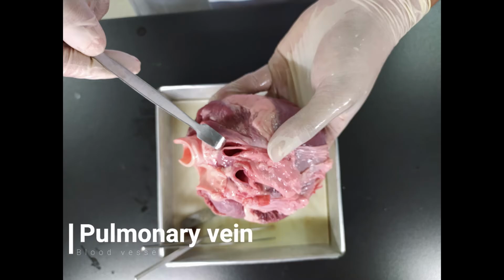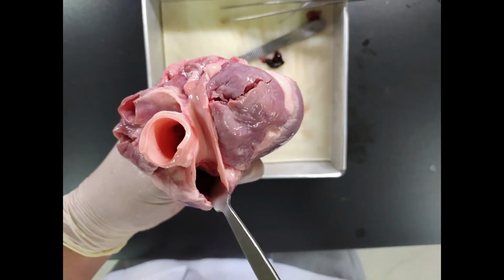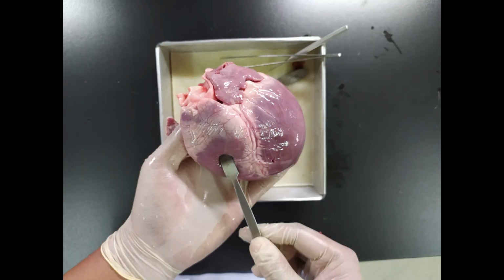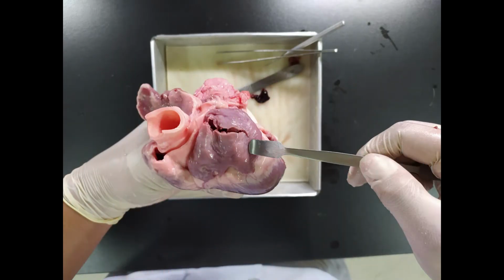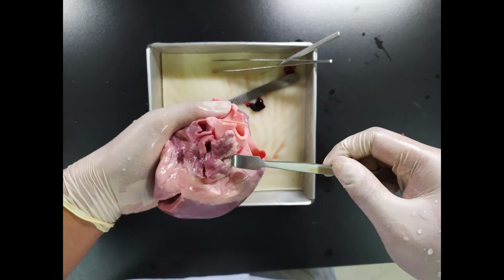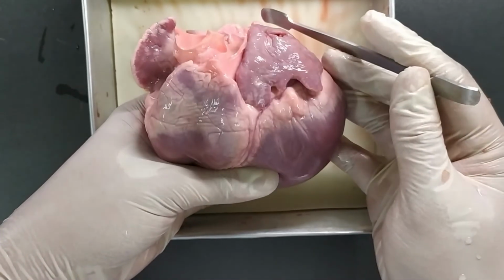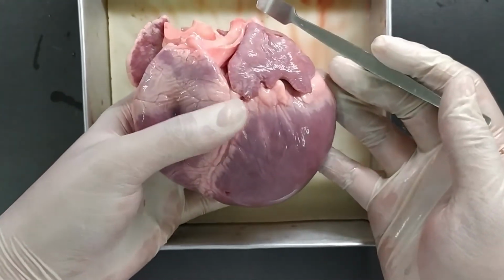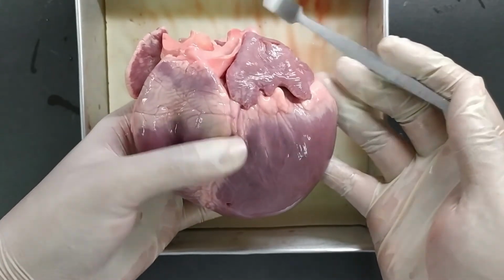Good day, students. Today, we will be dissecting a pig's heart. We will be using a pig's heart because, in comparison to a human's heart, it is anatomically similar but not identical. Last week, we talked about the components of the circulatory system, the blood vessels, and the heart. In our discussion, the blood moves across our body, including in our heart. For today's dissection and demonstration, we will try to see firsthand how circulation works inside our heart.